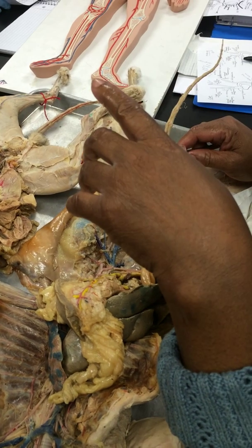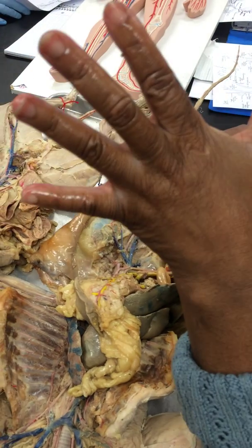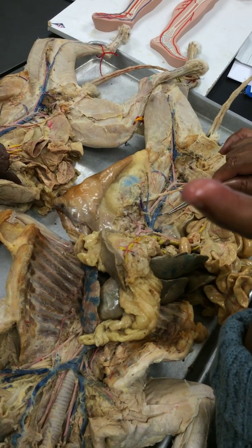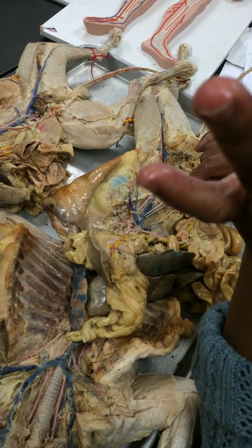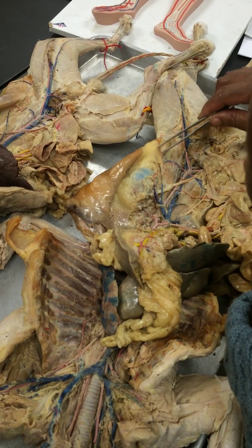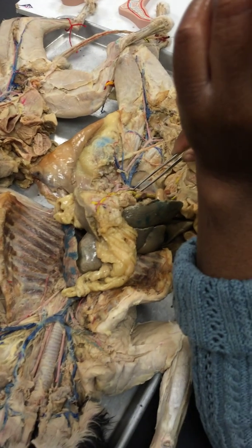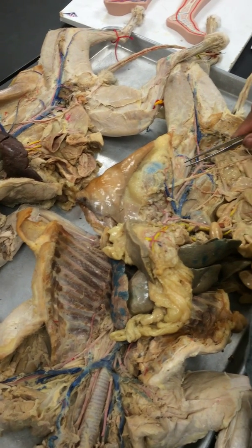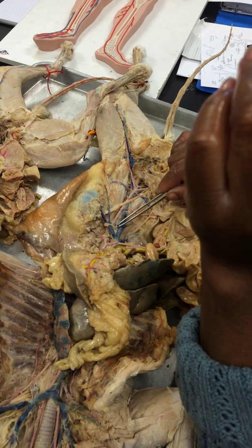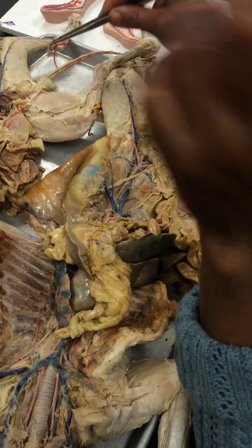So if I say trace a drop of blood from the right gonads, you would say right gonad capillaries, then right gonad vein, then inferior vena cava. If I say trace from the left one, you would say left gonad vein, left renal vein, inferior vena cava. So the pathway is different because you have to come into this before you come into that, whereas for this one, you come straight into that. And that is true for humans and cats.